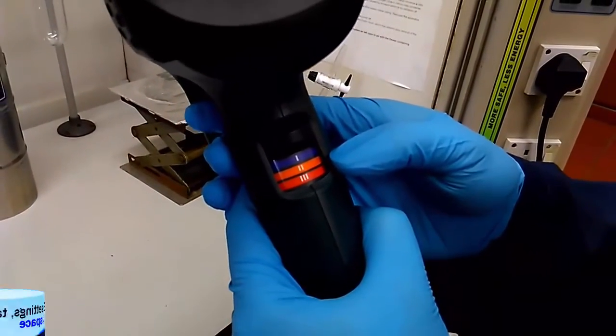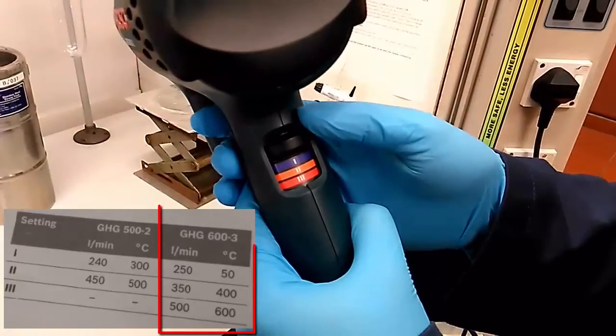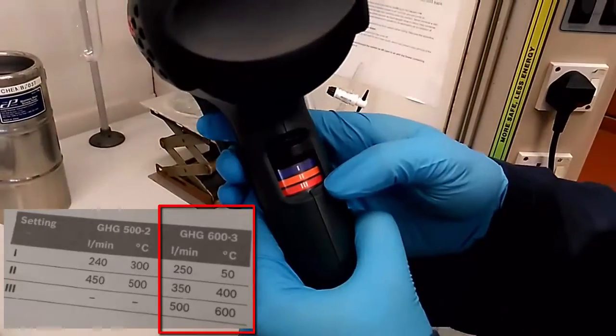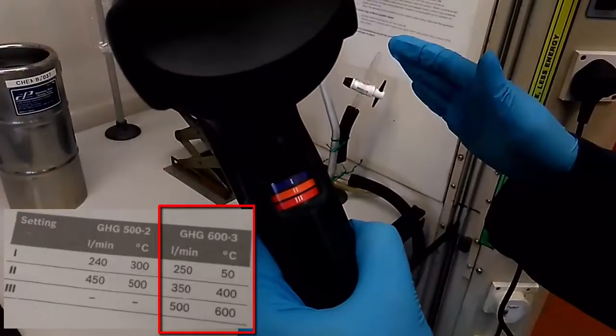For setting 1, the temperature is about 50 degrees Celsius. For setting 2, it's about 400 degrees Celsius. And for 3, it is 600 degrees Celsius.